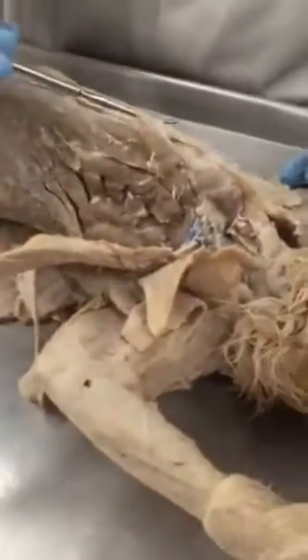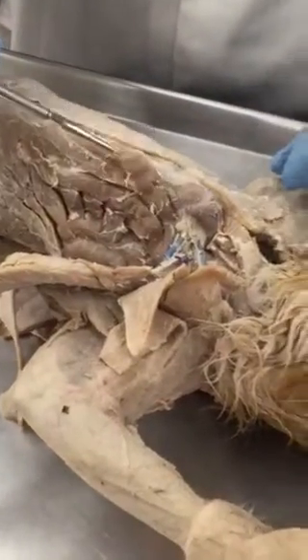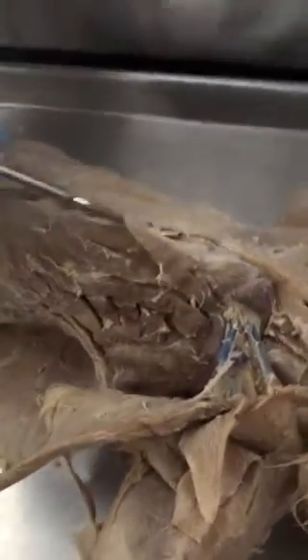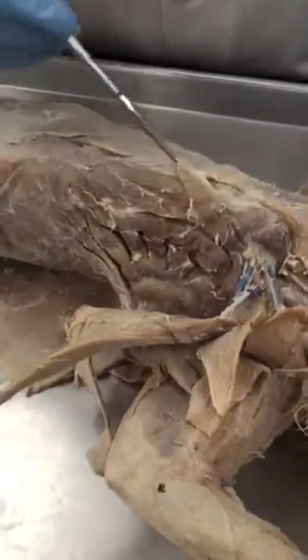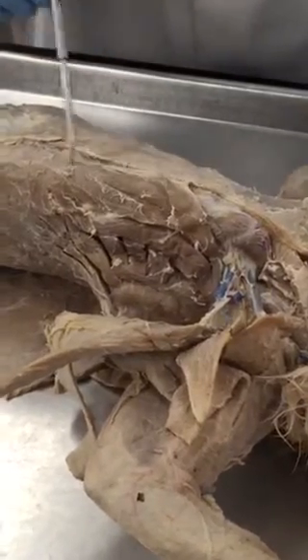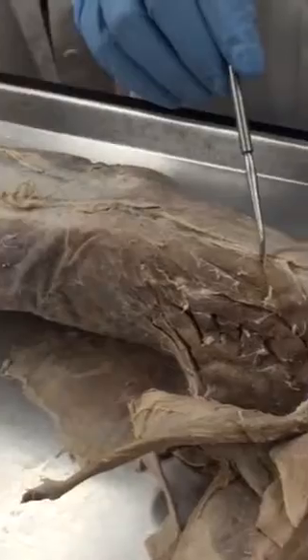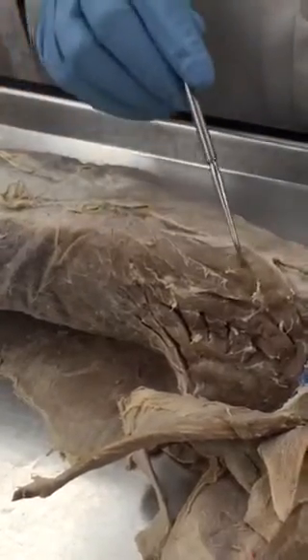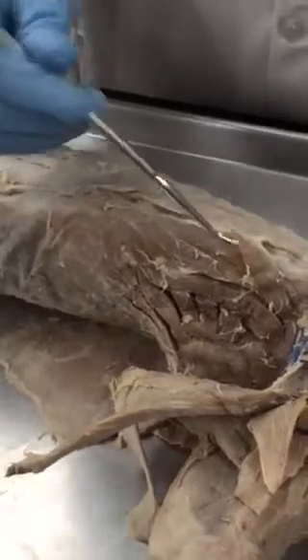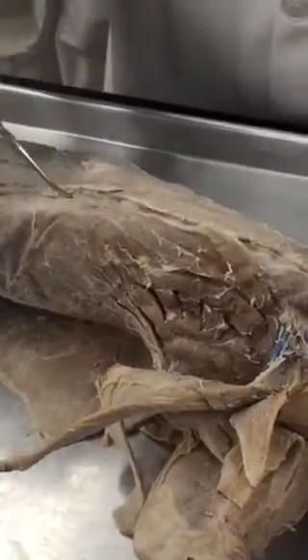This one that has a thin ligament that attaches to the sternum is transversus costarum. Transversus costarum is on the cranial part of the linea alba. So this muscle here is rectus abdominis, the cranial part of rectus abdominis. Transversus costarum, rectus abdominis.